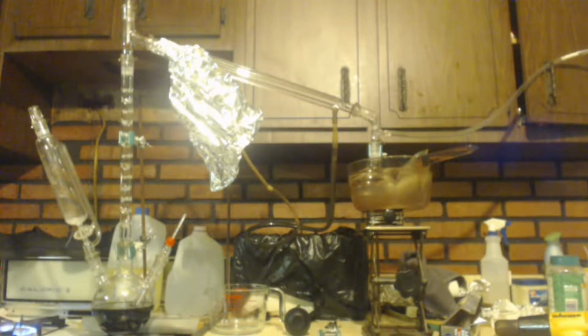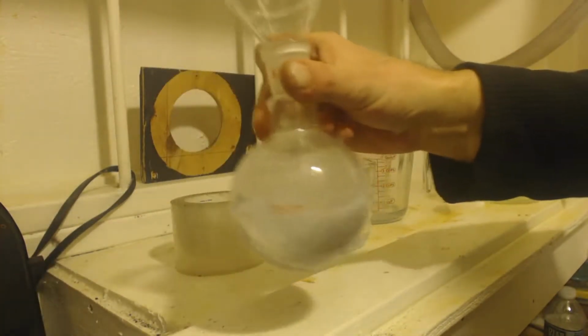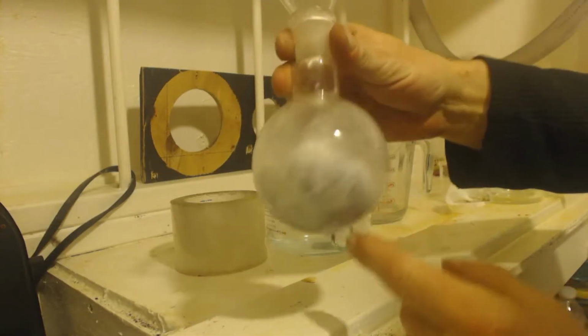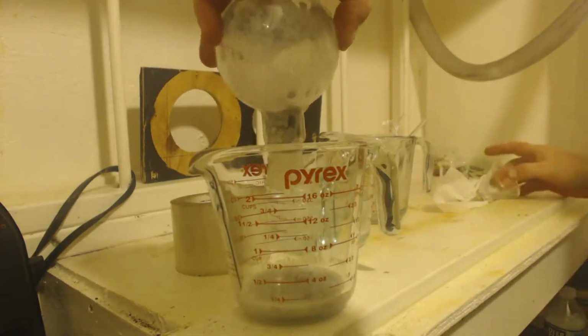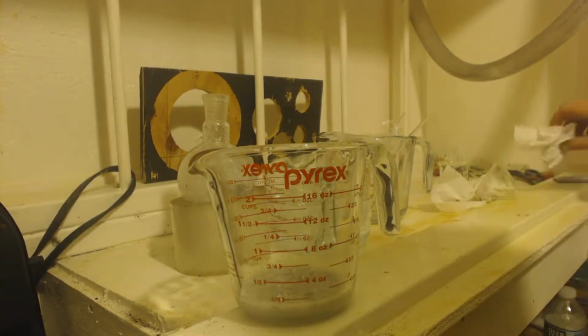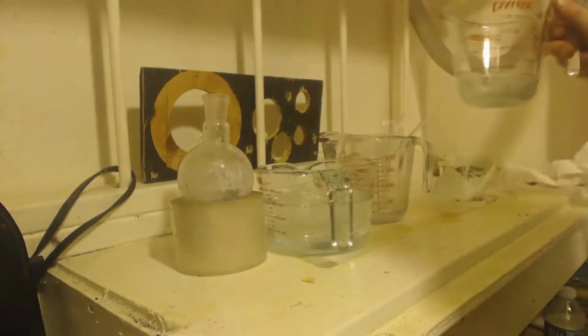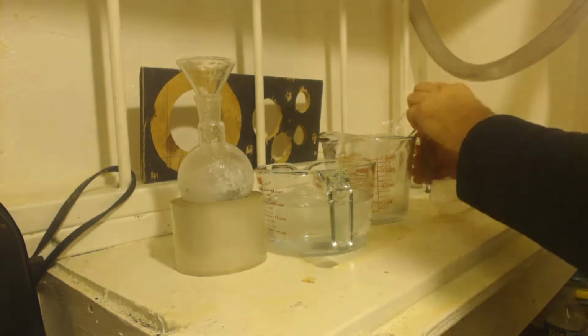I'm still adding that. As you remember in the last video, everything was a solid. Once I added that and swirled it around a little bit, I poked it with a glass rod and it basically came all apart. So, it was no big deal about it being a solid. Putting that in helps because look, it's nice and liquidy now, although I got a big chunk on the side here. I'm going to pour it into this right now. Yeah, it was producing a lot of hydrogen because of the metal. I wasn't even thinking of that. So here, I'll put some more of this, the last of that third of a mole.